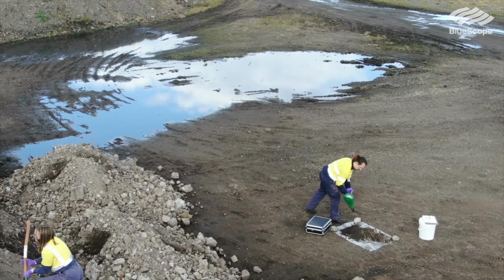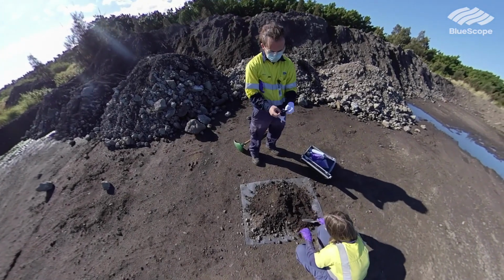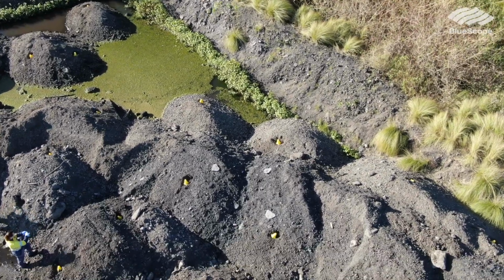It's extremely important to classify a waste before handling it, so it can be a safety issue, but also from an environmental perspective, so that we're being responsible with our waste on site. Making sure that we know, both in our lab and for all of the people doing the processes on plant, exactly what's in the waste and what's in the water that goes through the plant as well.